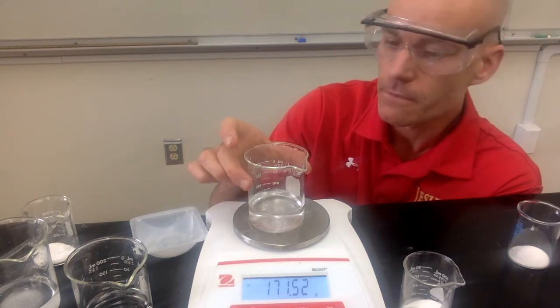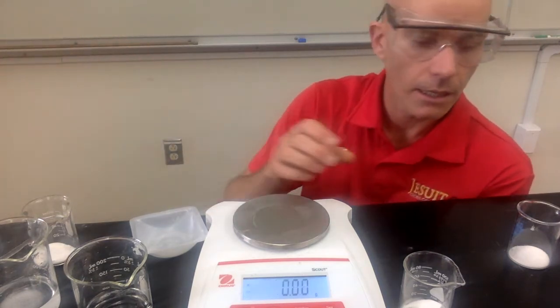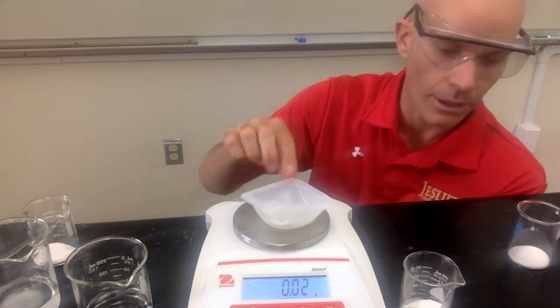All right, that looks pretty good. I'm going to take that off. All right, now we're going to do it with the mixture.